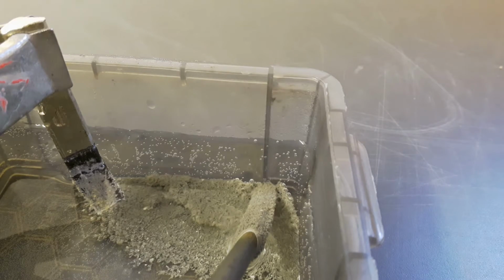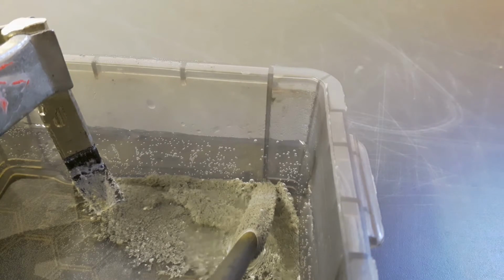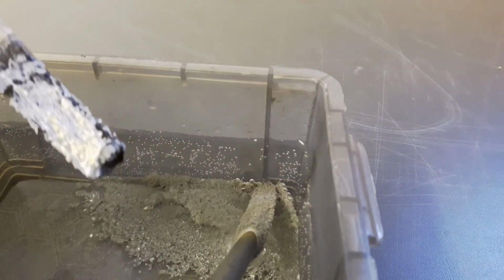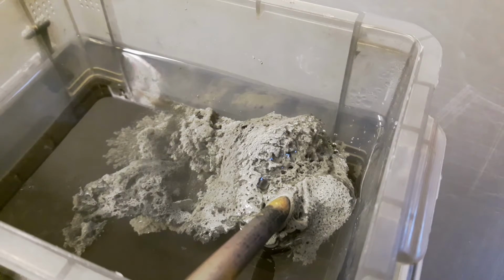And yes, the hydrogen production decreased. Don't like it. Maybe because the surface of the iron did shrink and is now coated with this tin fur. And I think the white powder that was created is actually tin oxide, because, oh, I can't get focus on this now. If there are thicker particles, they have a slightly yellow tone, and this is a clear sign that it's tin oxide.